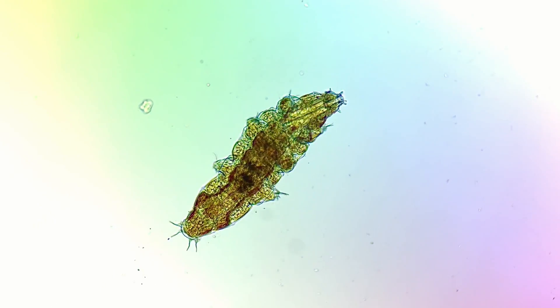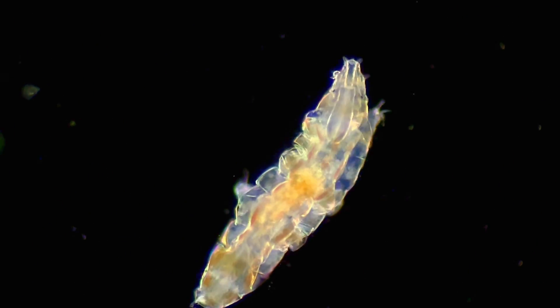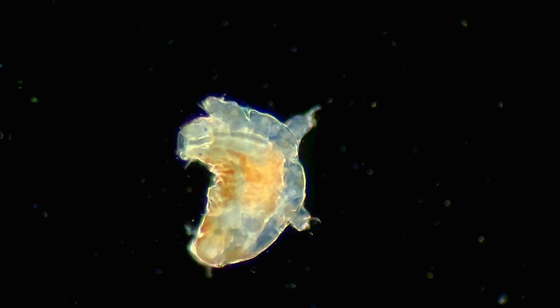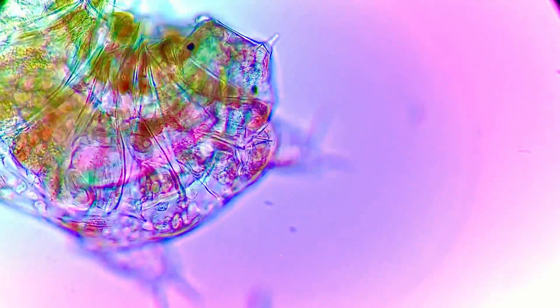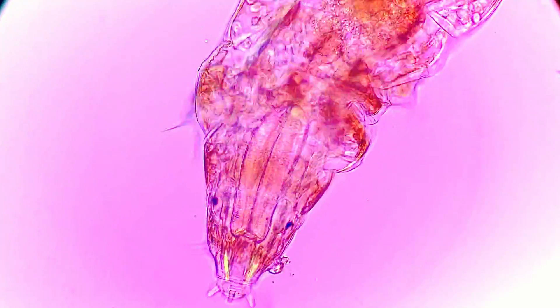Overall, I think this is the best technique to find a water bear — finding a water bear this way has never let me down. These creatures are tiny, but they are large in number and found all over the world. But for the budding microscope hobbyist such as myself, the tardigrade or water bear proved to be a very difficult specimen to obtain when I first started playing with microscopes.